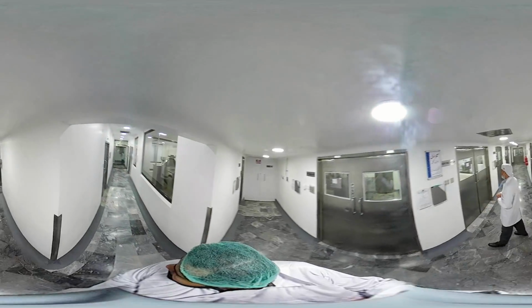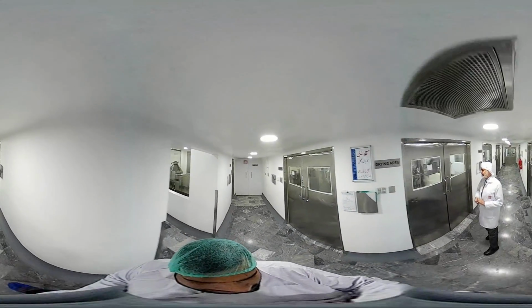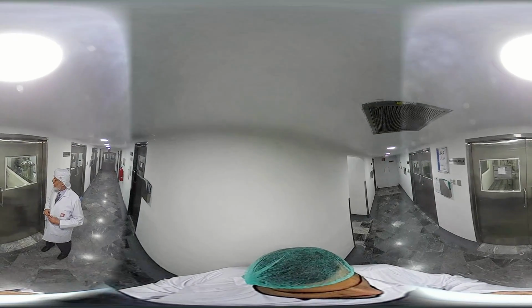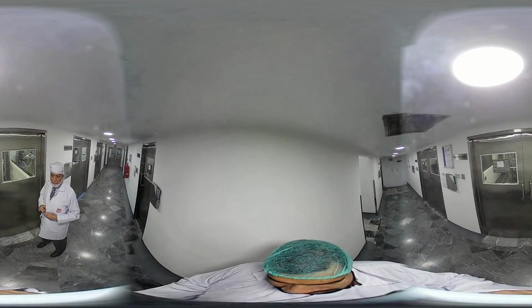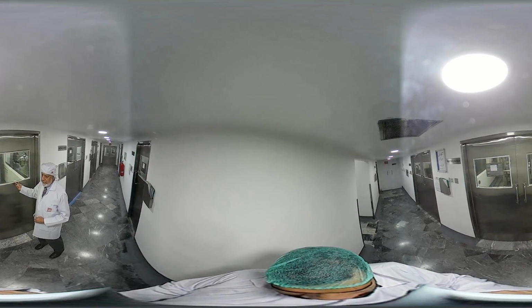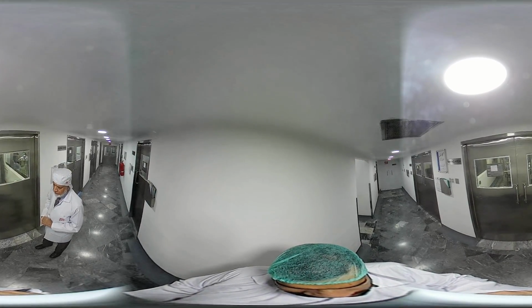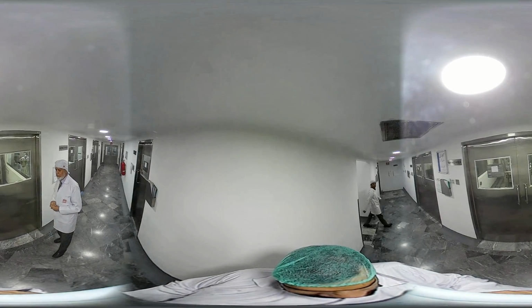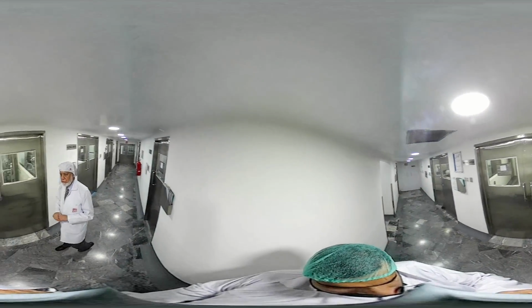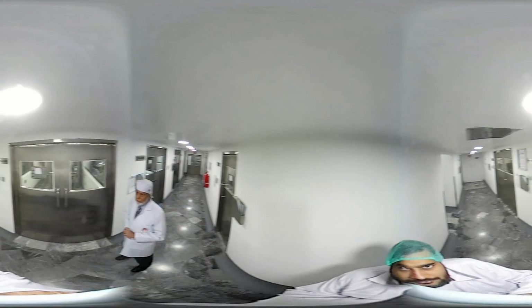Once we move past the wetting, the next step is obviously drying. It's a fluid bed dryer, again with a capacity of almost 150 to 200 kilograms. Drying is done here as per the requirements. It varies from product to product as far as the drying time is concerned. And this is one of the very efficient pieces of equipment from the drying point of view.